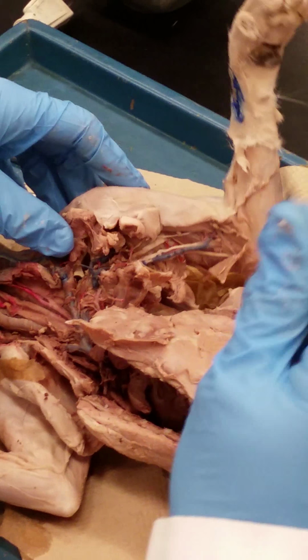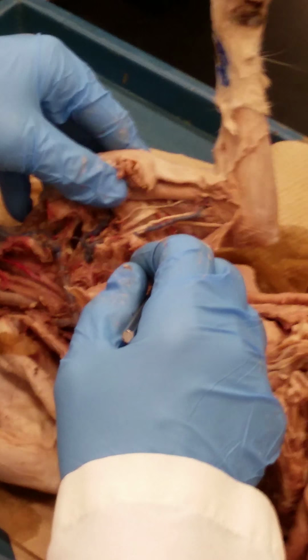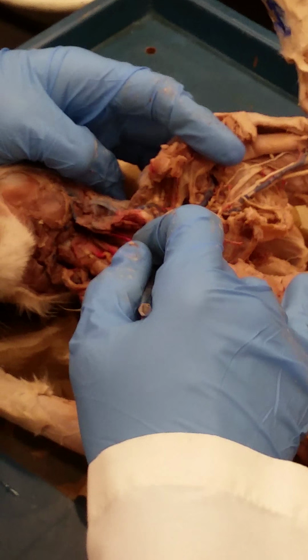Okay, so people can go over there and look at that. And there were some very good ones in the Tuesday lab, so I don't know whose kitties I'll be using, but it's fair game. This third branch off the brachiocephalic vein is the external jugular vein.